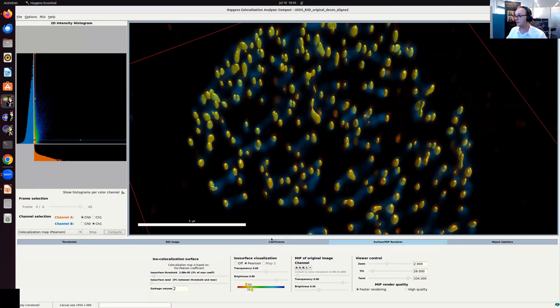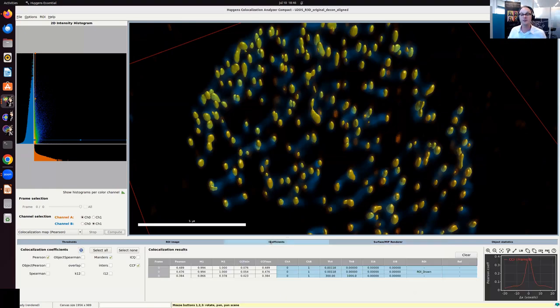Okay, so just to reiterate, to get to Pearson, I just can use this tool. It has many more options, like the Manders coefficient and the region of interest. If I like, I do this for the 20 cells for each iteration 3 times. I can automate this. We'll show that in a later session. And these are the Pearson coefficients that then enter in my box plot. And if I then like, I can also use this Manders coefficient to paint a more sophisticated picture.